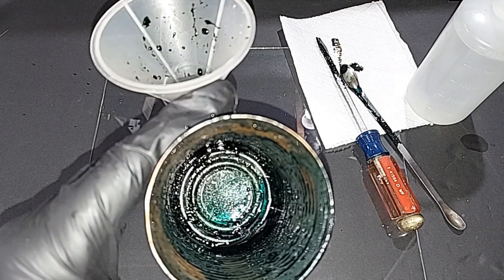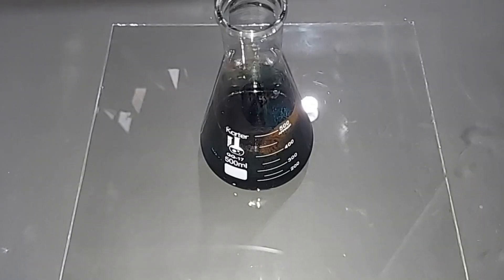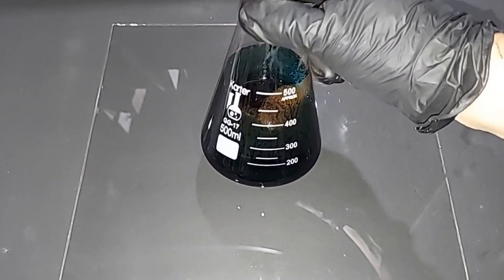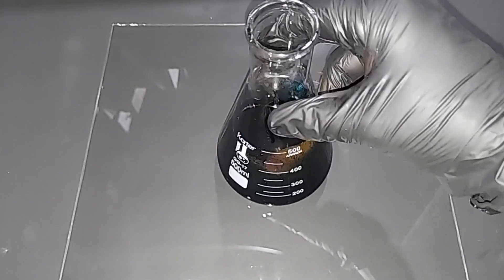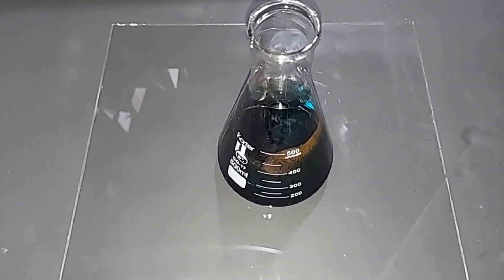Okay, pretty good. Not going to get much more out of there. I cleaned everything up, and there's about 225-230 milliliters here of the manganate in water. I'm going to stir this with a magnetic stirrer for a good hour to two at least to make sure everything is broken down nicely before we go to the next step.